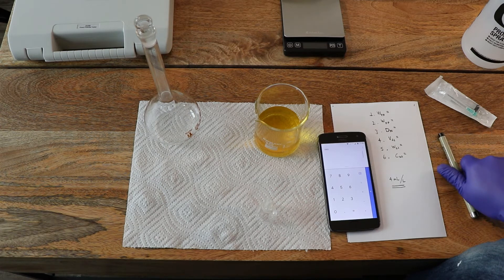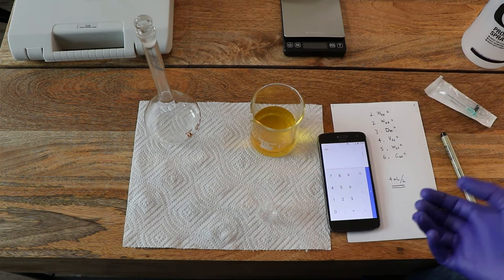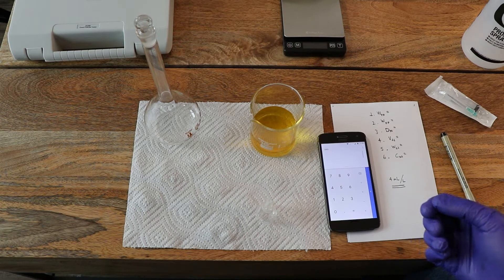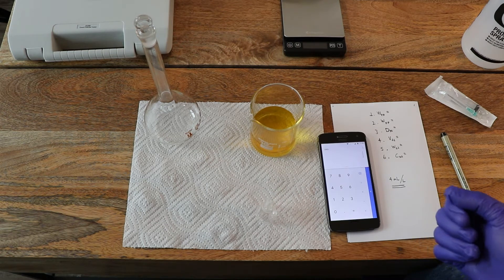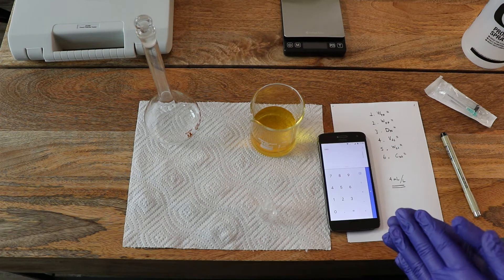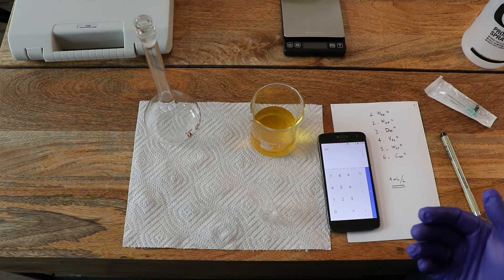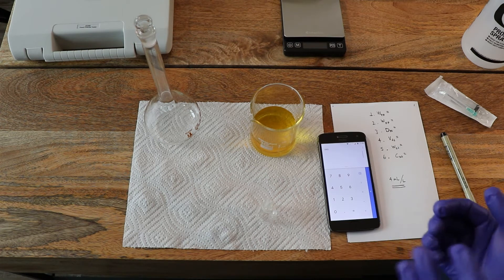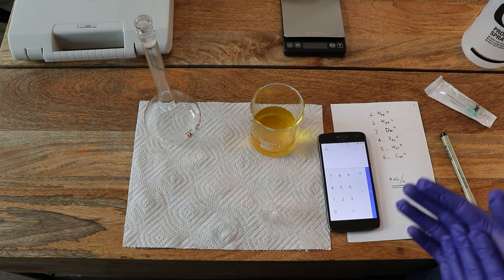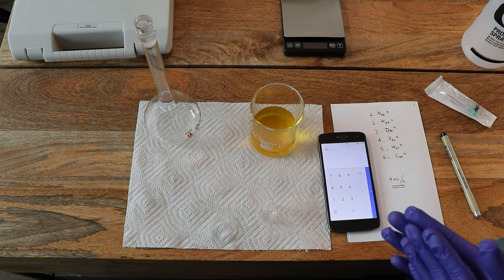So how do we measure the density of this solution? To measure the density you just need to measure a very exact and precise volume and then measure the weight of that volume very exactly as well. But how do you measure a very precise and exact volume?